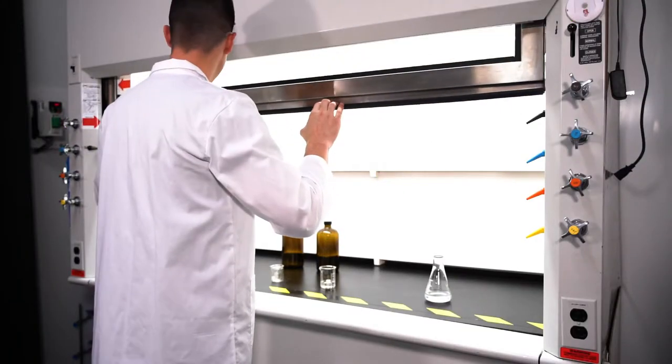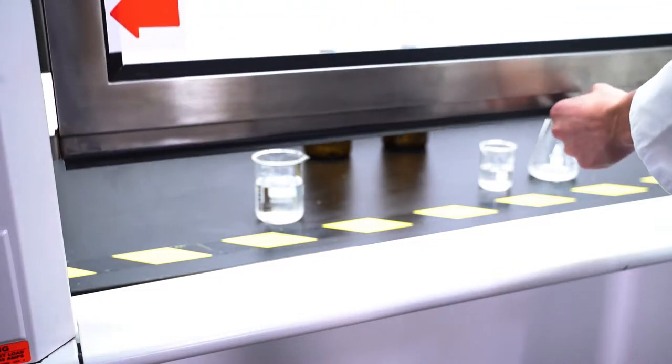Always keep the sash at a lowered operating position and closed when not in use.